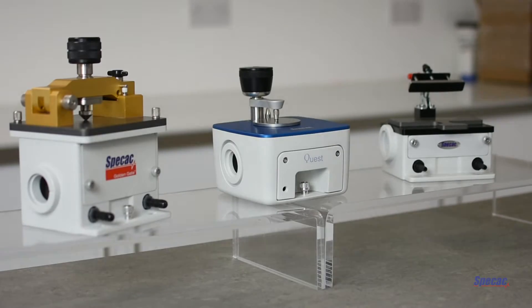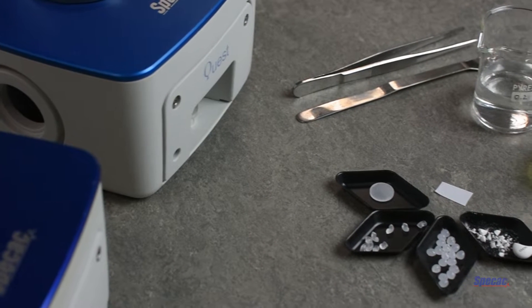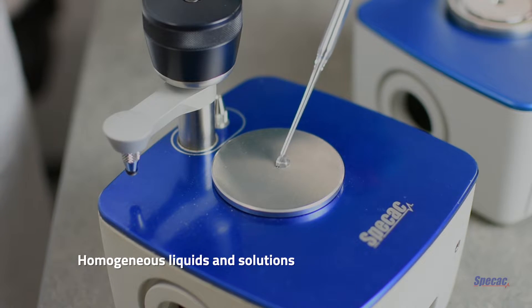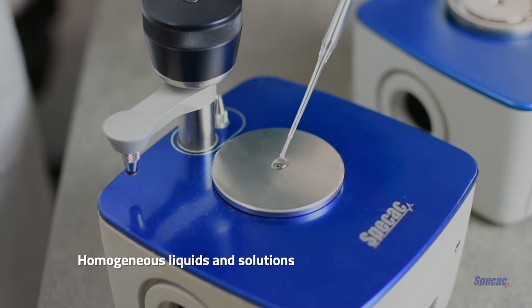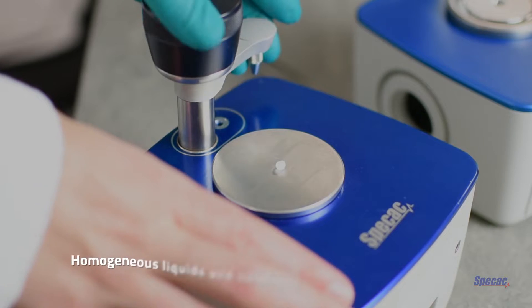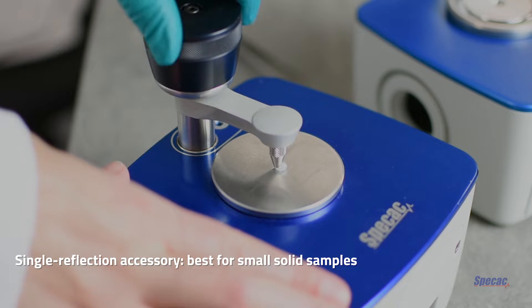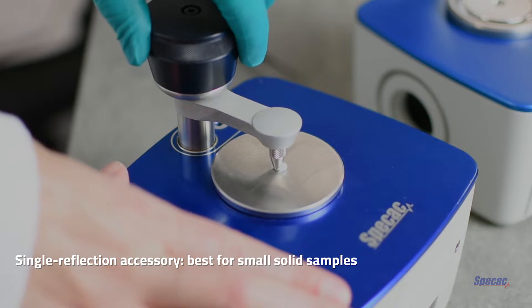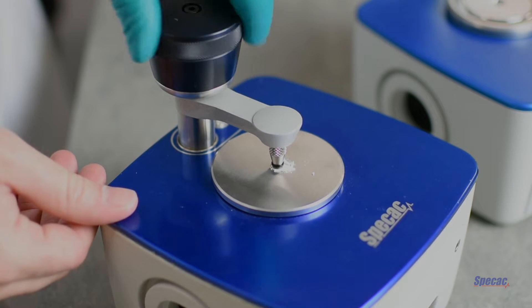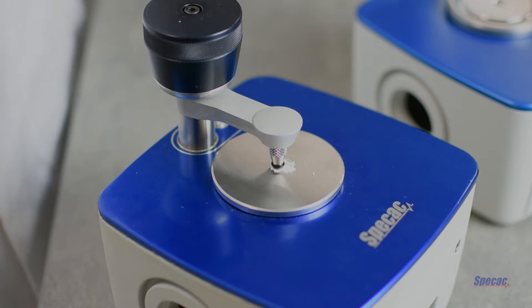The configuration of the ATR accessory does affect what samples it is best at analysing. All ATRs are highly effective at analysing homogeneous liquids and solutions — we simply need to ensure that we have enough sample to cover the entire ATR element. Solid samples such as plastic pellets, fibres, gums, coated films and so on are really best analysed using a single reflection ATR accessory, because we need these samples to make firm, repeatable contact with the ATR element.